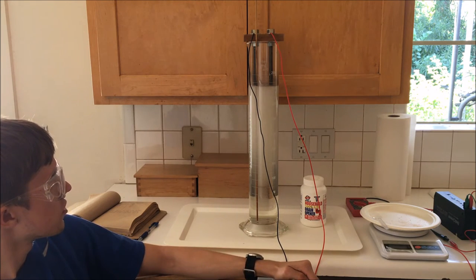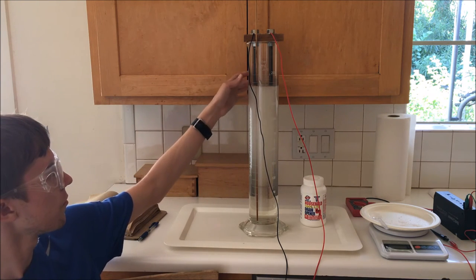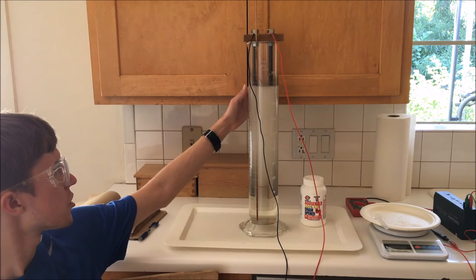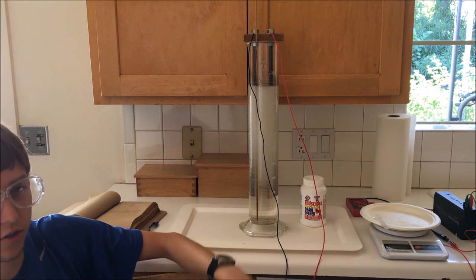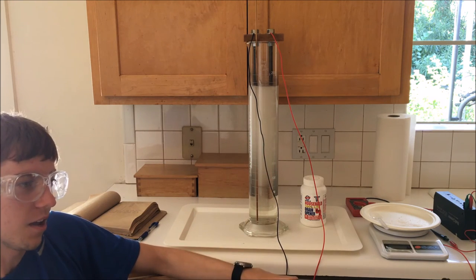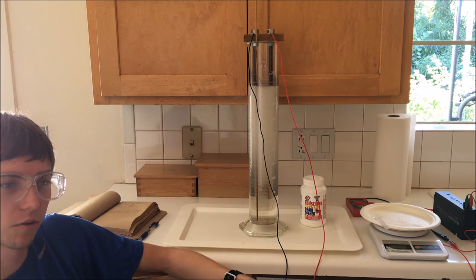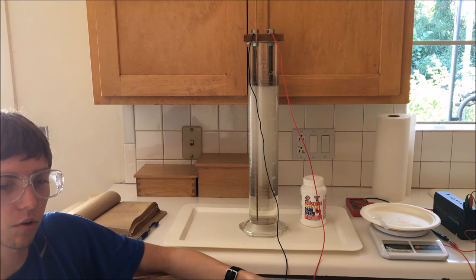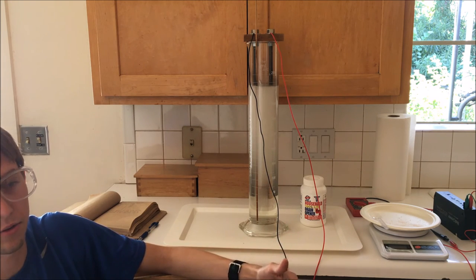I am not noticing too much discoloration to the water. I am noticing some black powder floating at the top of this. I'm hoping that's not my electrodes dissolving. I suspect it may be the machining oil from when these threaded stainless steel rods were originally machined, and not the actual stainless steel itself. If it does end up being that the stainless steel electrodes begin to corrode, I can try scrubbing the corrosion off with some sandpaper, and if that still doesn't work or if it builds up corrosion too quickly, I may end up having to use a different electrode like graphite or even platinum.